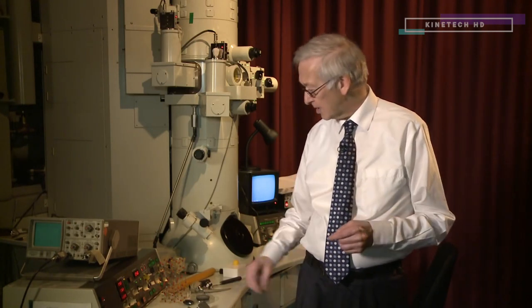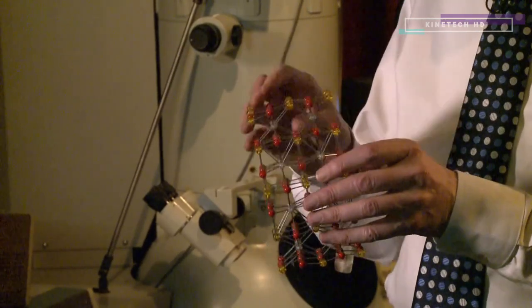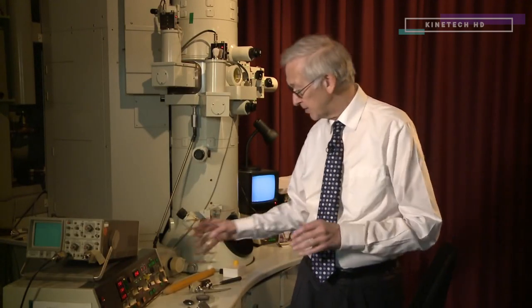With an electron microscope you can magnify 10 million times, so you can actually see the atoms in a material and you can see right through the material. These electrons penetrate right through the material so you can image the interior. For example, this is an atomic model of a high temperature superconductor, and in an electron microscope you can see all these atoms, analyze what the different atoms are, see the interior of the material, and see defects inside which are also important.